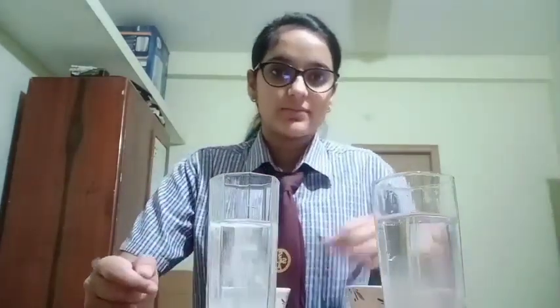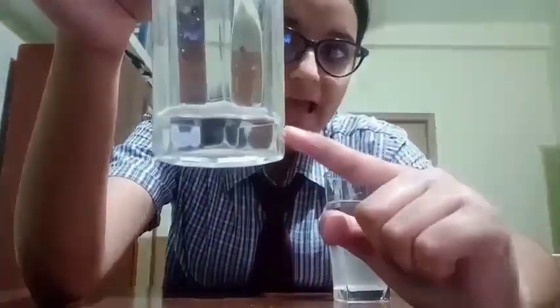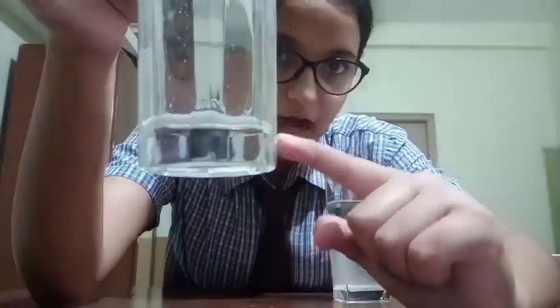Let's check the result after some time. We can observe that sodium hydroxide is totally dissolved in water, and the calcium carbonate — the powdered chalk — is insoluble. As you can see, the particles of calcium carbonate have settled down.